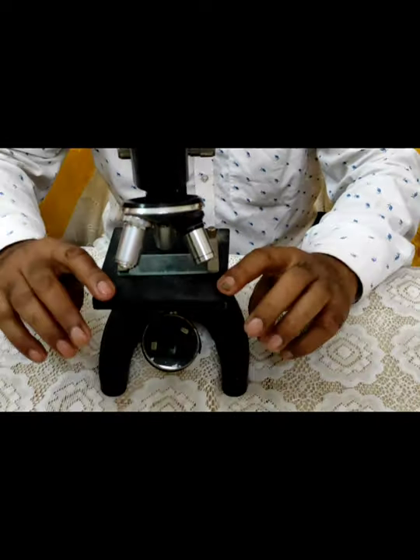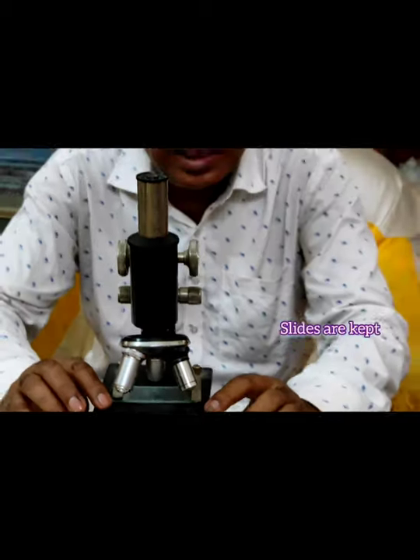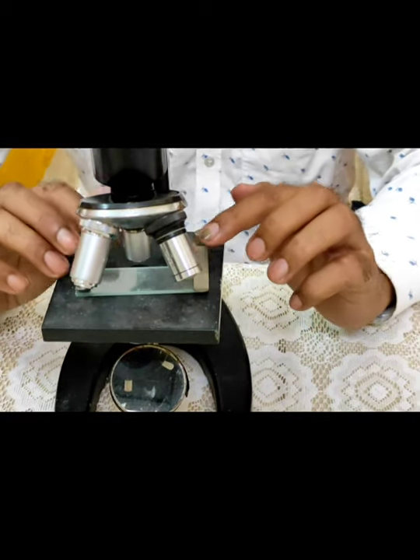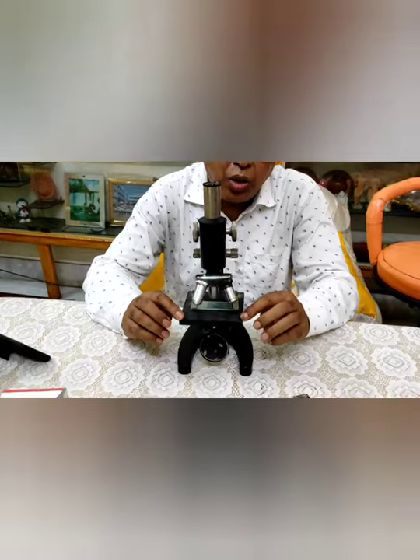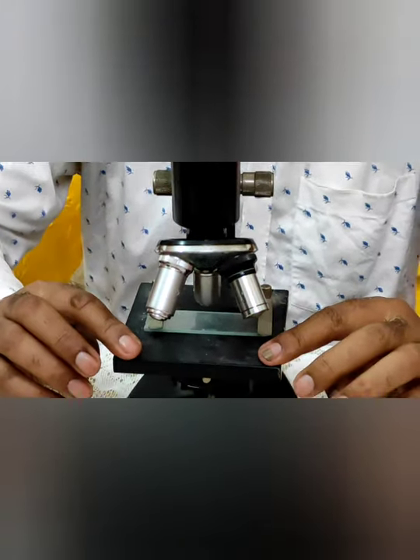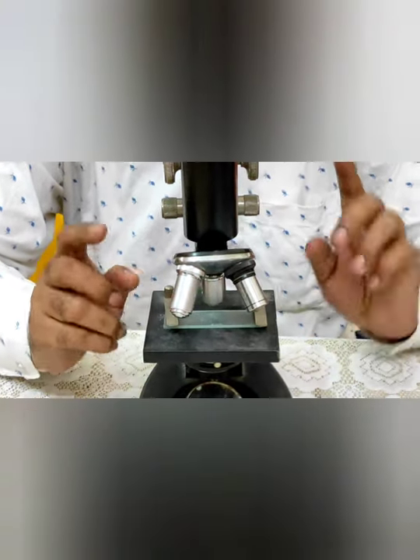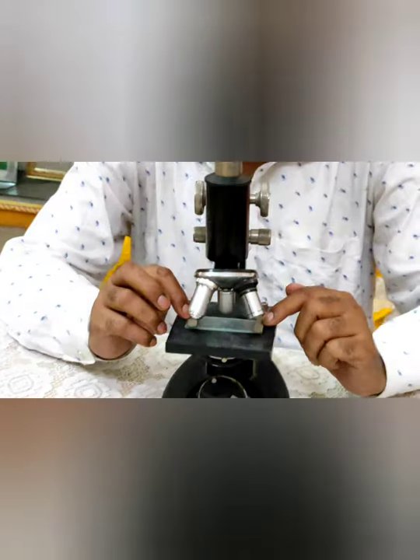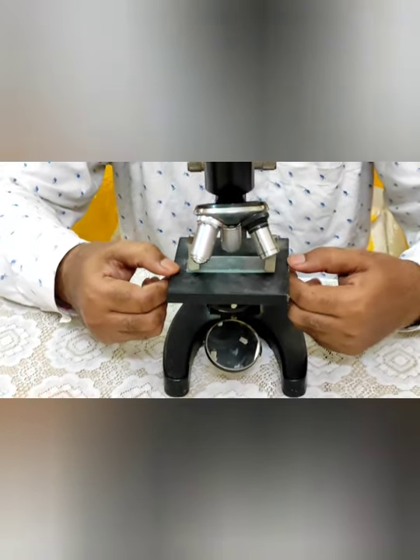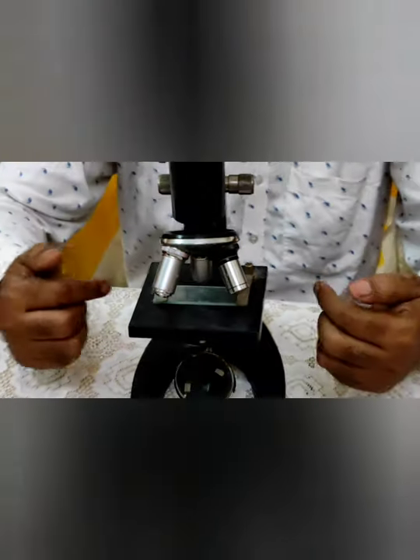This is the base or stage of the microscope on which the slides are kept. These slides can be firmly attached with the help of a mechanical stage or ordinary clip. Here you can see the ordinary clip — mechanical stages are not here. In costly microscopes there are mechanical stages, with which slides can move in forward and backward or left and right movement.